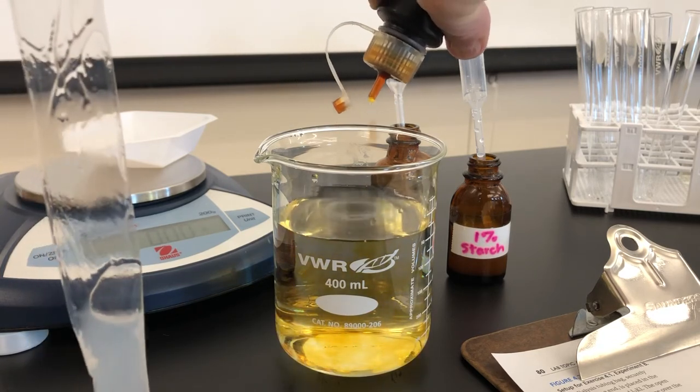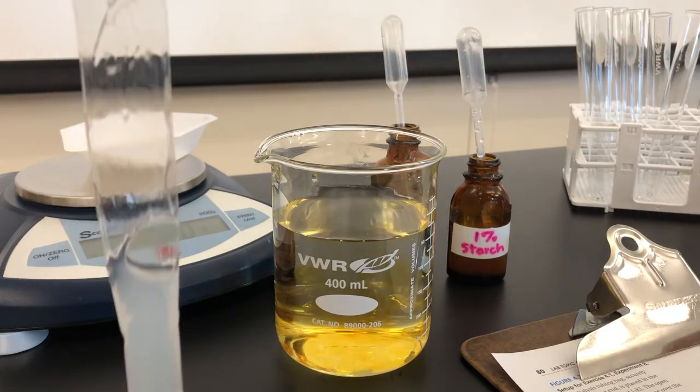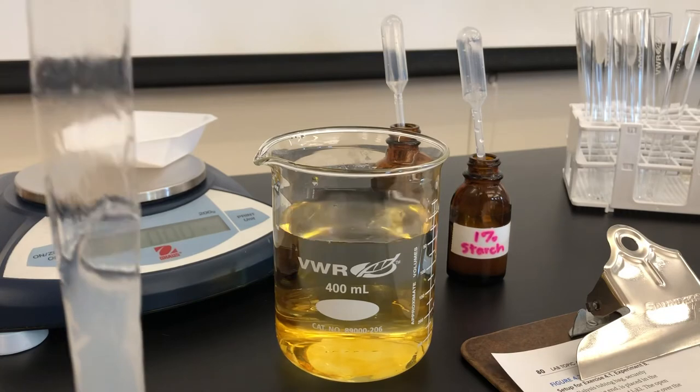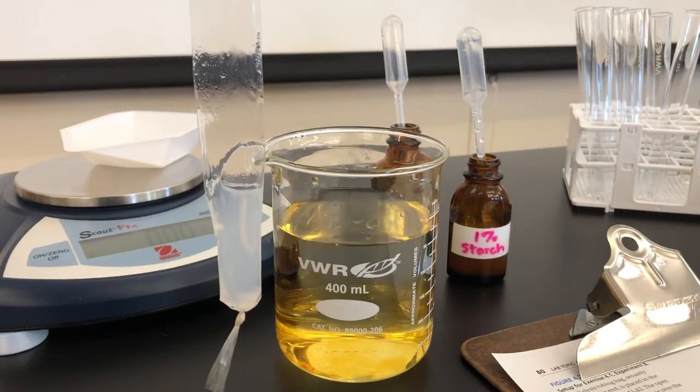Note the color of the beaker water now. And that's the color you should put in the table 4.1. So note the color of the bag and note the color of the beaker.